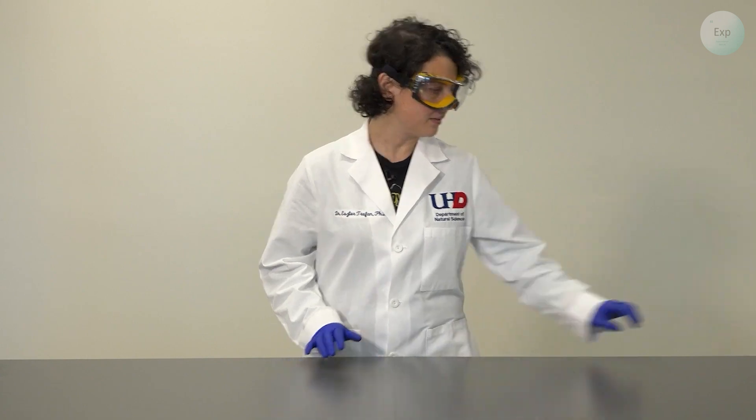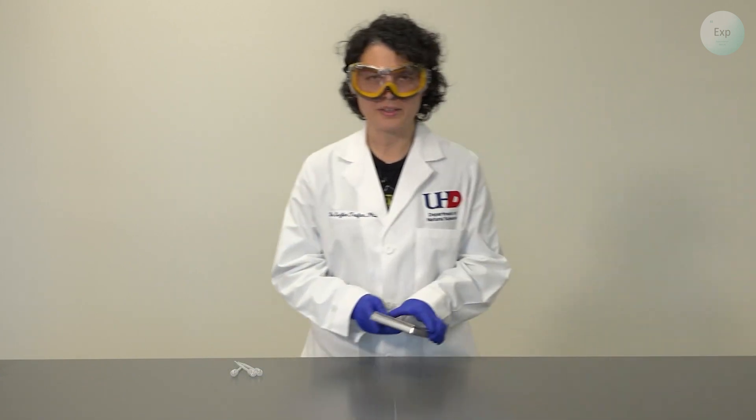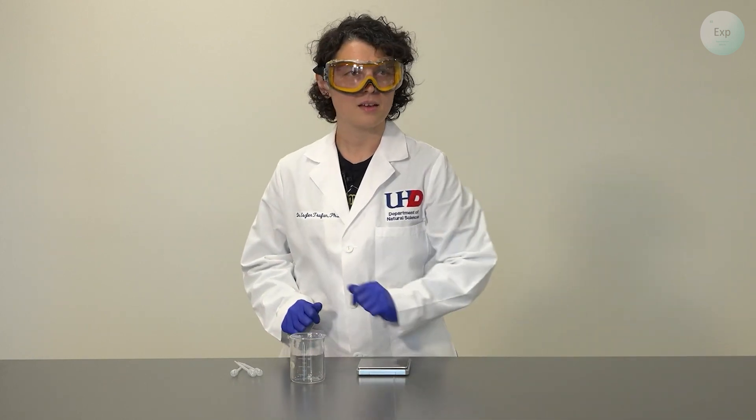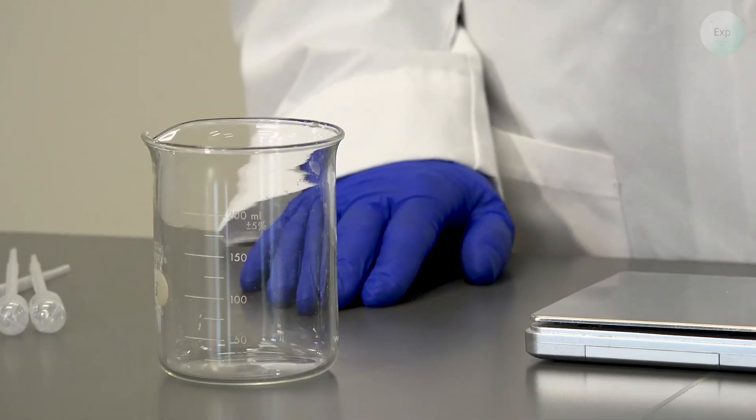So for the experiment we're going to start with some equipment. We'll need some pipettes, a scale, and a beaker. It doesn't have to be very large but a 250 milliliter would be the ideal size.